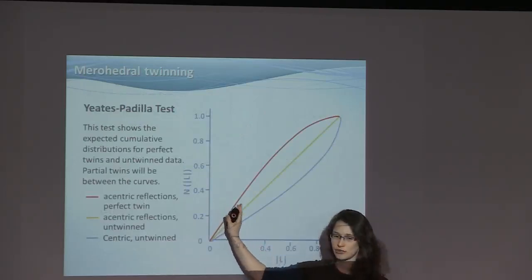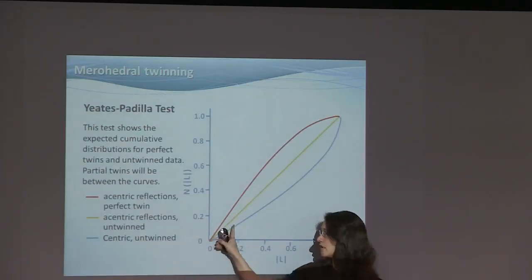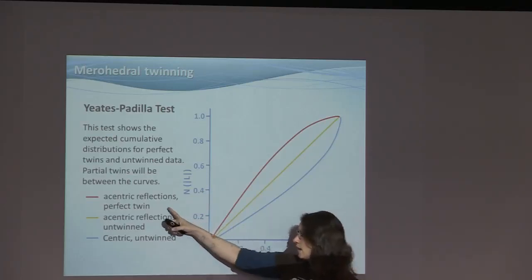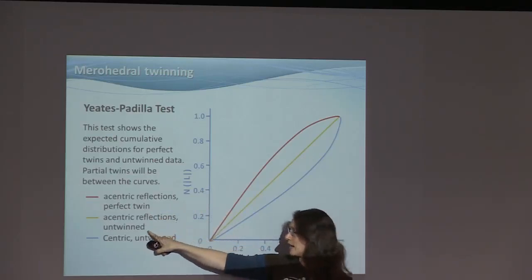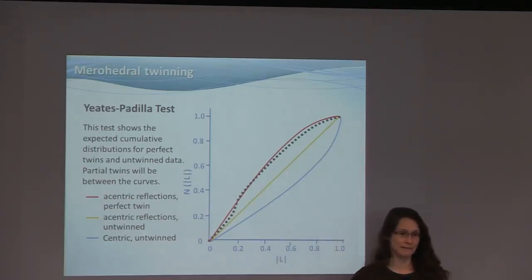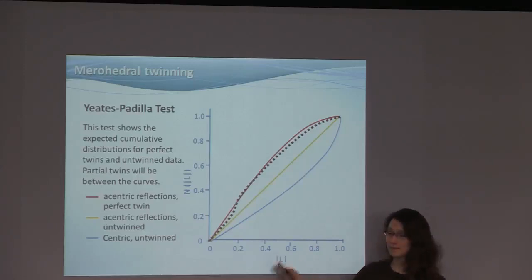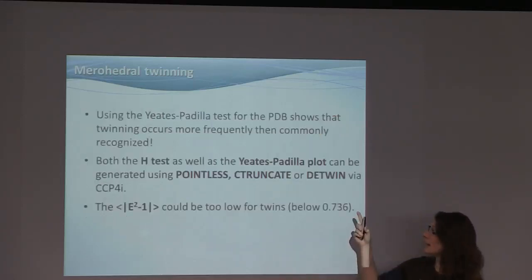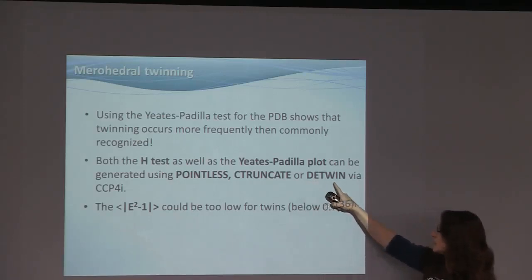And we are only looking here at the red and the yellow line for acentric reflections. The centric one is often omitted, but I've drawn it here so you know it exists. For acentric reflections, a perfect twin would be on the red line. An untwinned structure would be on the yellow. If we get something like this, what would we have? Yes, exactly, a perfect twin. This is also known as the Yeates-Padilla test. So the L test is also known as the Yeates-Padilla test.